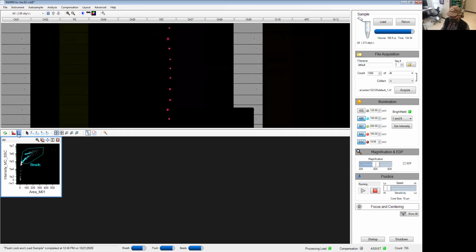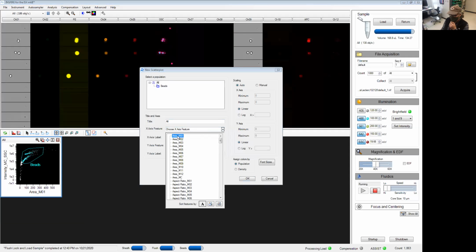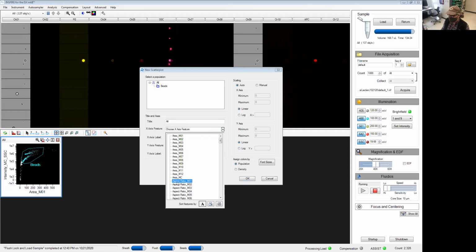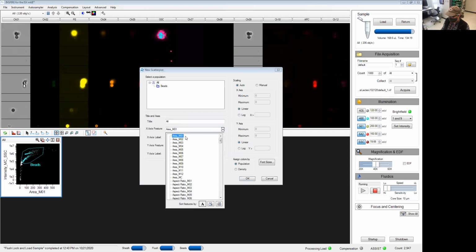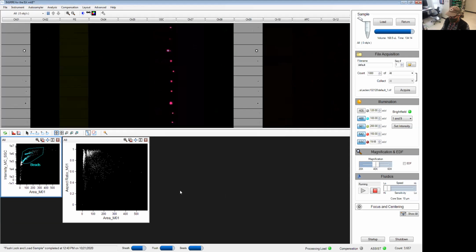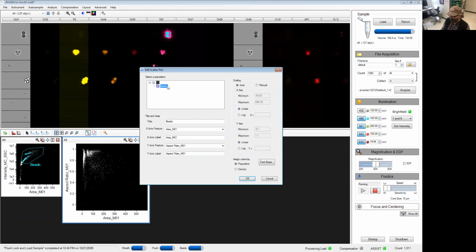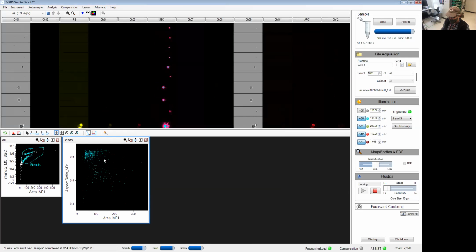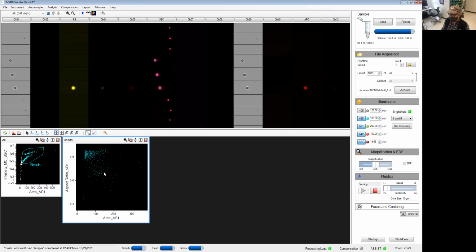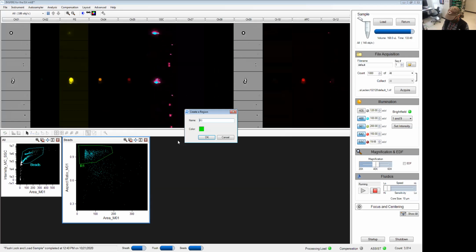Next graph we're going to use is going to be to discriminate against doublets or clusters of beads. I'm going to use area on channel 1 against the aspect ratio. And I forgot under graph properties, you can apply this bead gate here by clicking on the gate within that select population window. Now the only events that are going to show up here are going to come from my bead region. You can see a cluster of events here. These are the single beads. The outliers are my clumps. I'm going to select single cells.